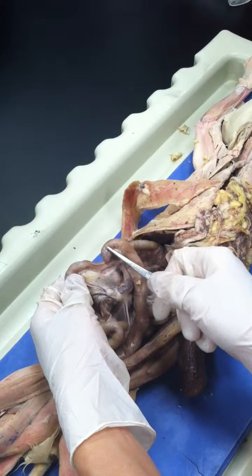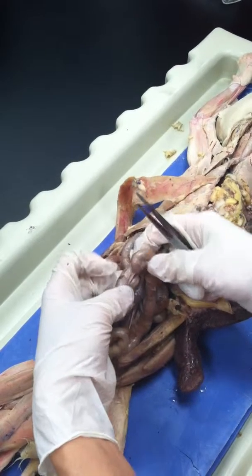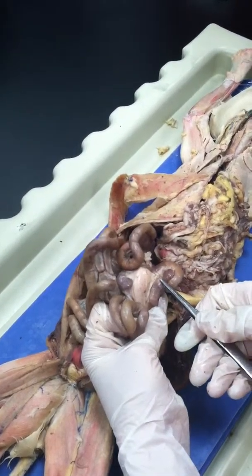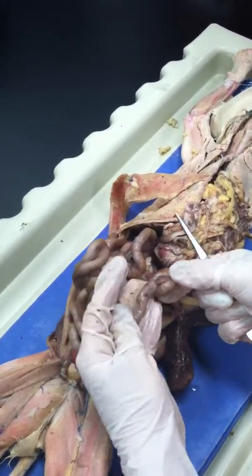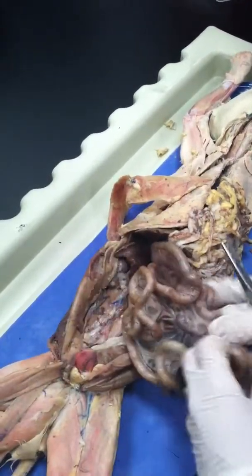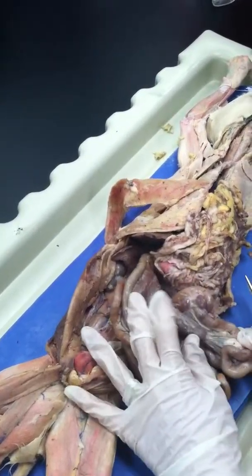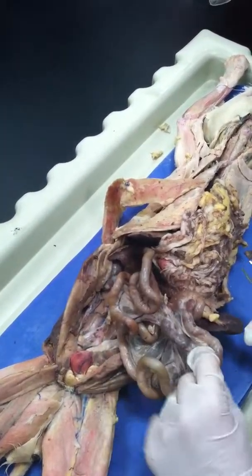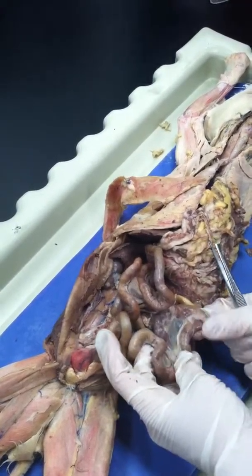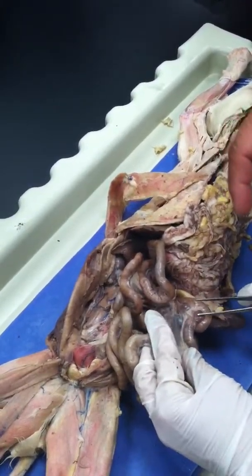Ascending colon. Here. No, it should be. Because you said it was small. This is the cecum. Where does the ascending start? So then the ascending. We said it was a really small space. No, just very short. Can you turn the intestine to that side? The short part, like this, because the colon should be on that side. Okay. Where's the ascending? Short piece just above the cecum. We can't see. Just an inch above it.